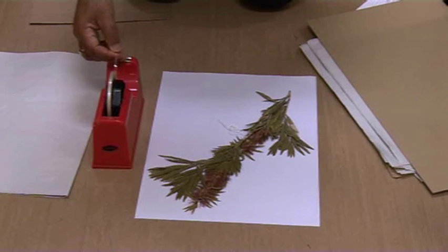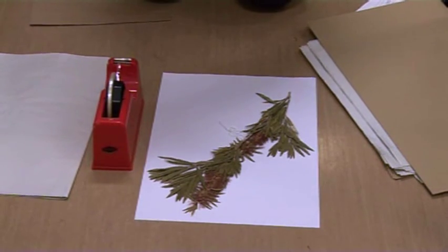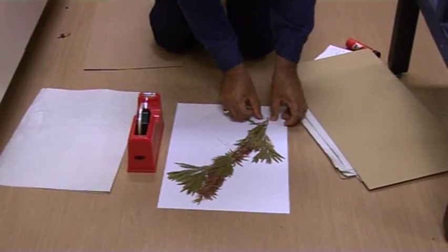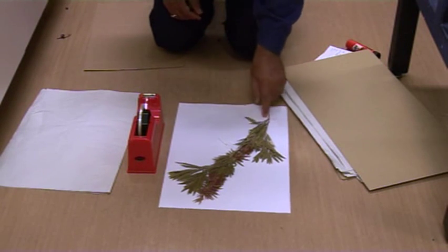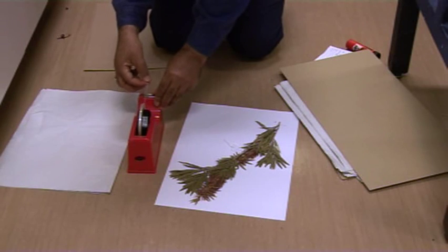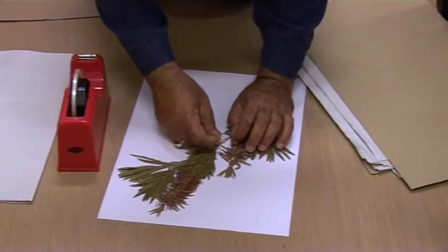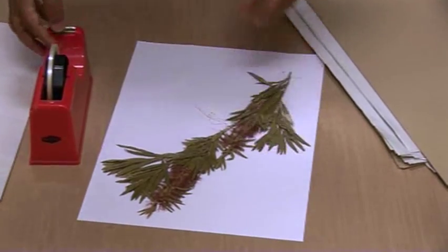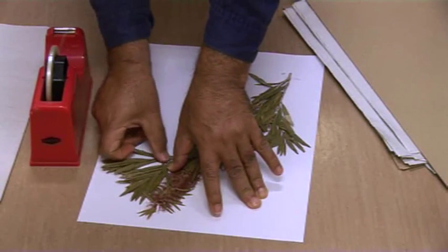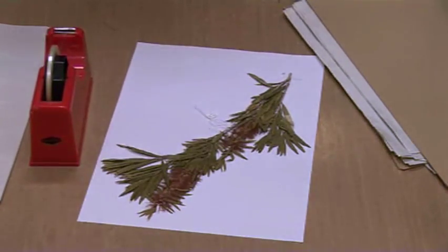What we do is we use a tape — a transparent, translucent one. It shouldn't be too wide or too long. Just stick it there at one, maybe two to three places. You stick the sample at two to three places — one here at the bottom, one maybe in the middle, and one at the top. So now the sample is very nicely secured onto the white paper.